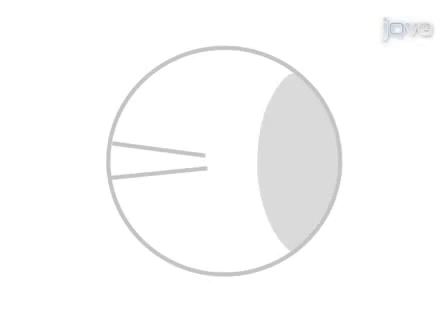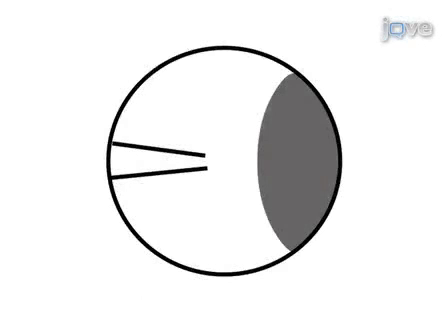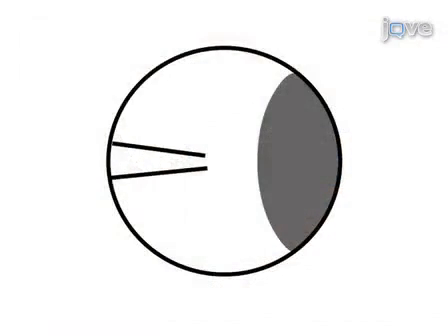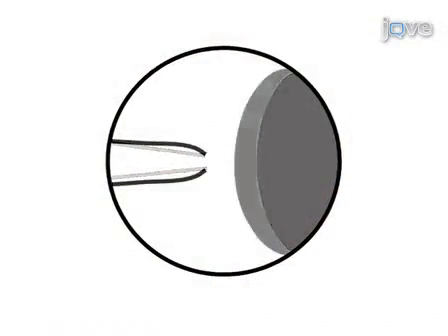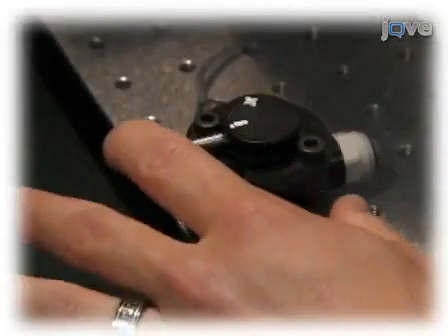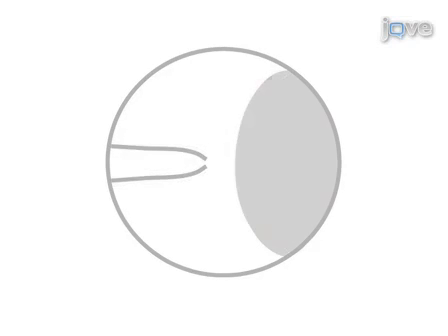This procedure begins by positioning the pipette tip near the polishing filament at 100 times magnification. Next, turn on air pressure and heat the filament. The pipette tip will expand to form a blunt-shaped tip. Turn off the heat. To obtain a smaller tip opening, turn off the pressure and heat again.